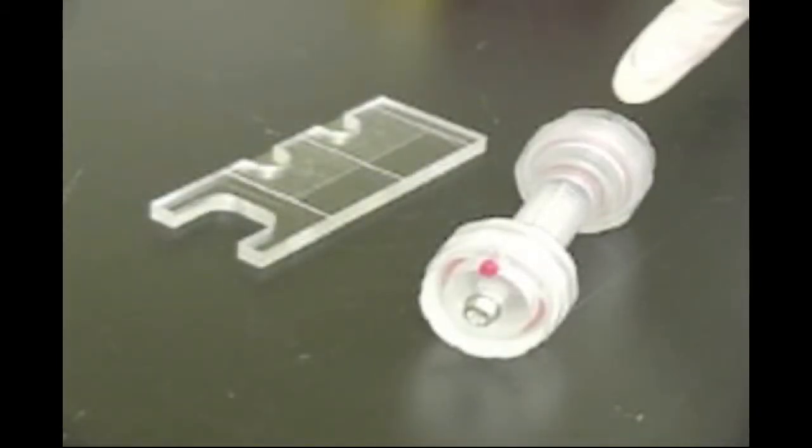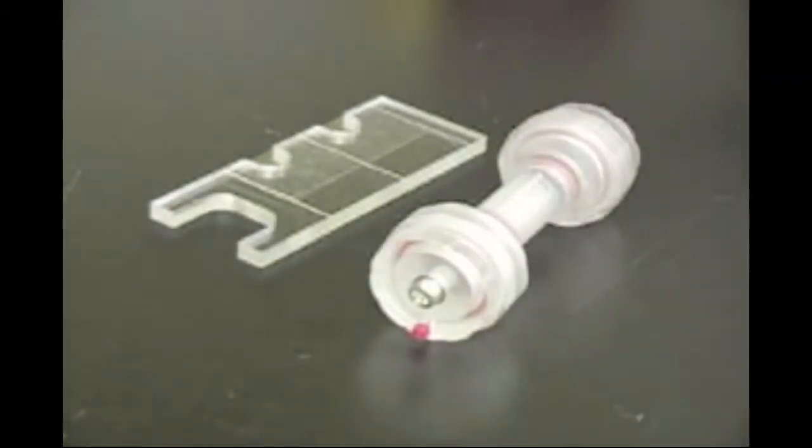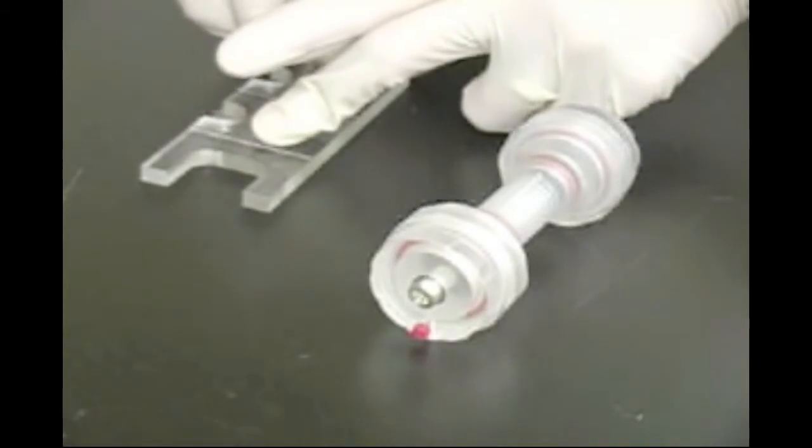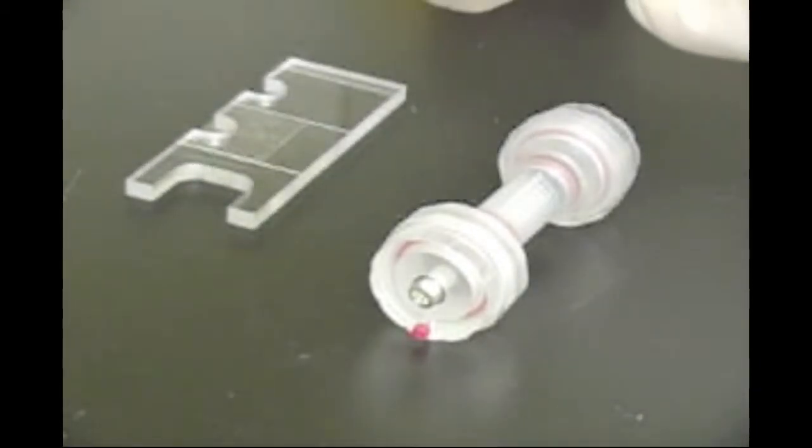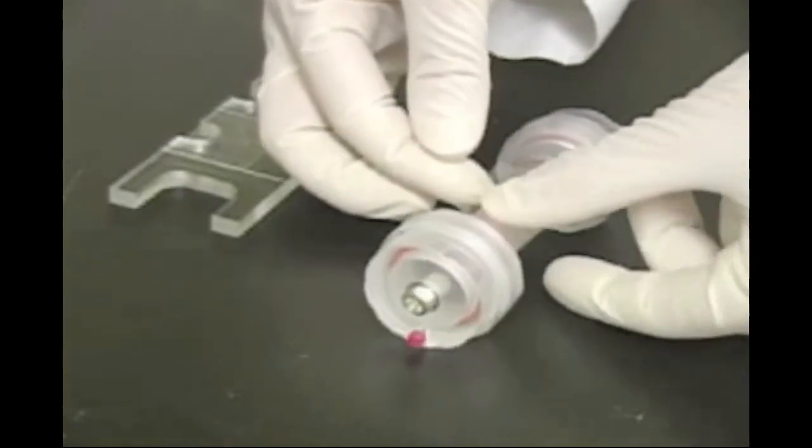Use one of the strips of tape to seal the row of ports opposite those that are aligned with the vents on the electrode assemblies. The ports being sealed will be the harvesting ports. Cover all of the ports and do not extend the tape beyond the focusing chamber.